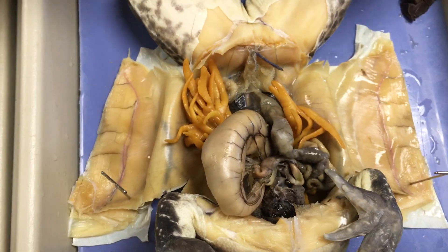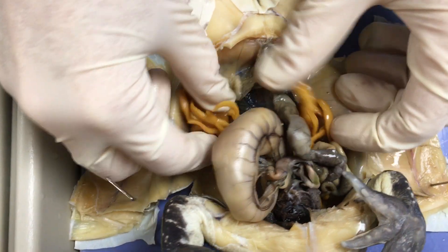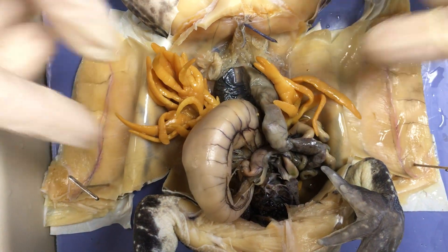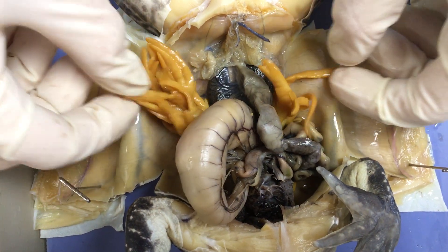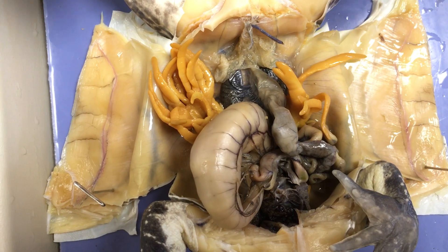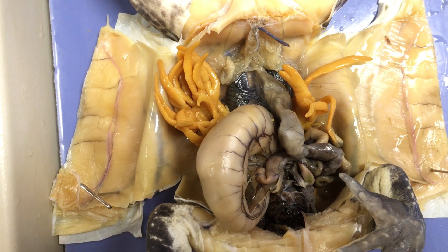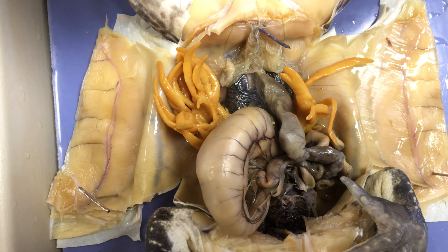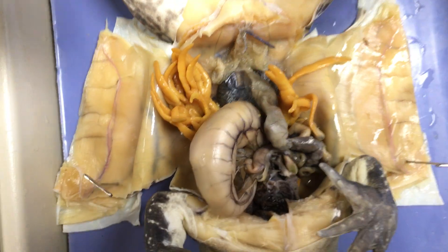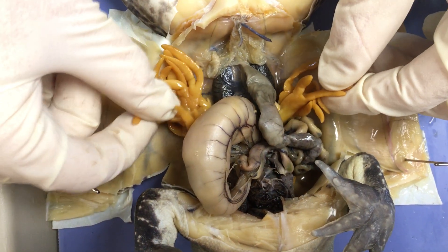Probably the most obvious structure that you are going to see once you move the liver out of the way are these yellow, finger-like projections coming out of both sides of the frog on the dorsal side. These are all called fat bodies. Just like the name says, they are there to store fat. Sometimes when you are dissecting a frog, you see very little fat bodies; sometimes you will see an abdomen completely full of them, which can indicate how much extra fat reserve these organisms have.